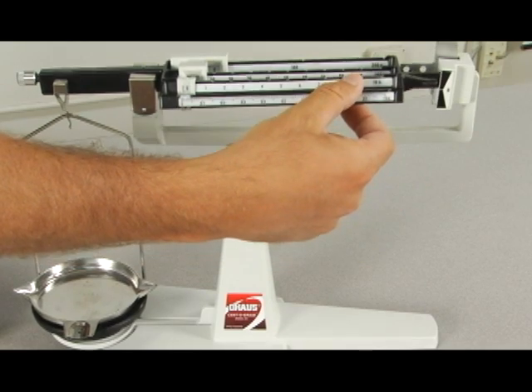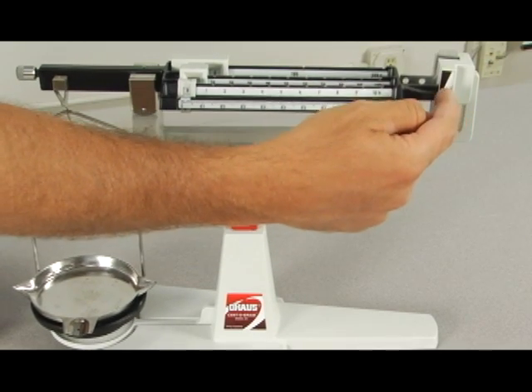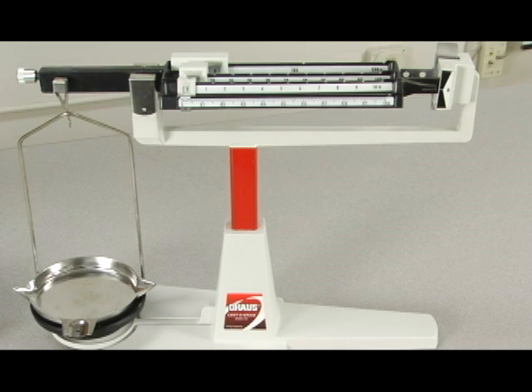The line that's on this movable section has been lined up with the line here. This is just like a balance that you'd find at a doctor's office.